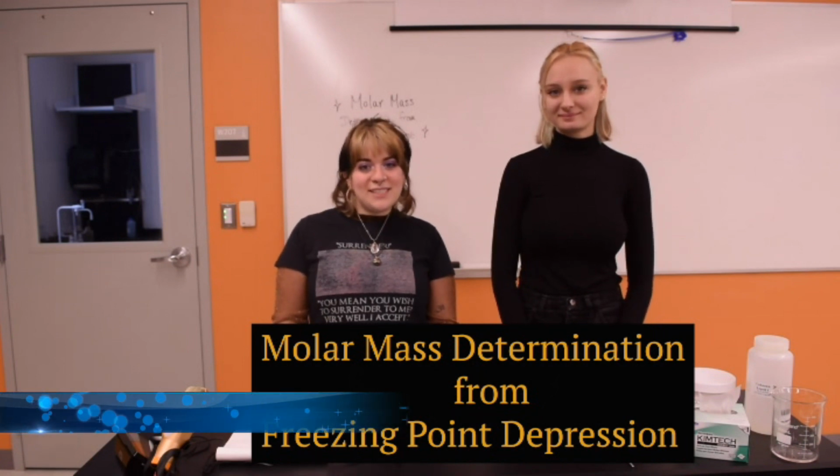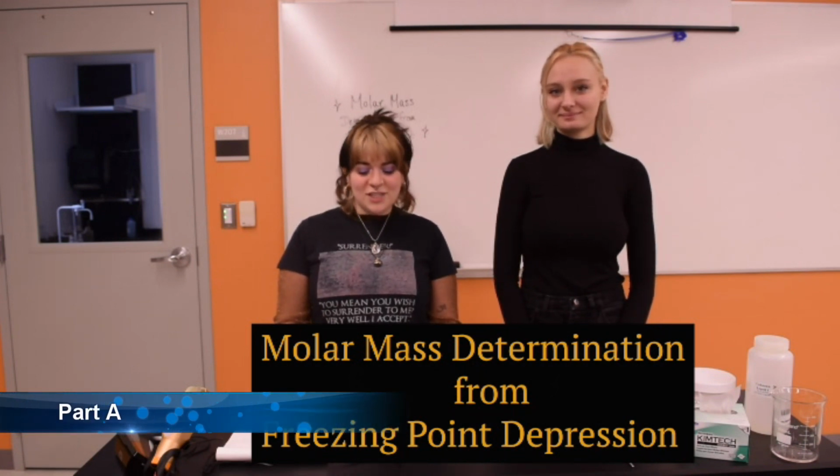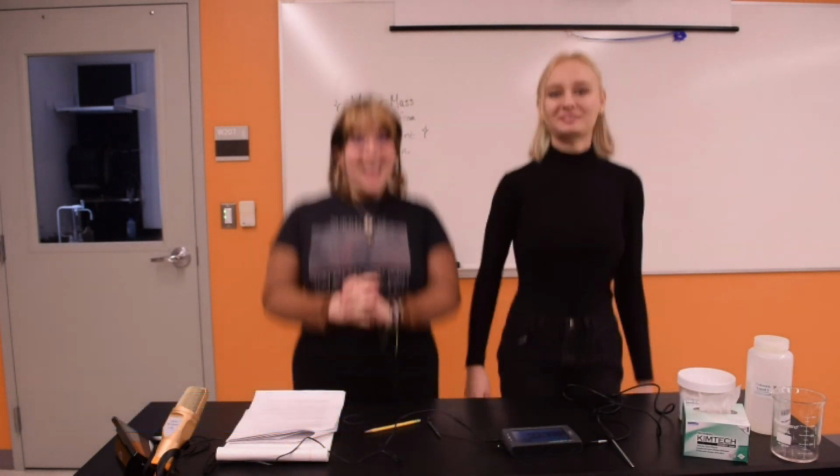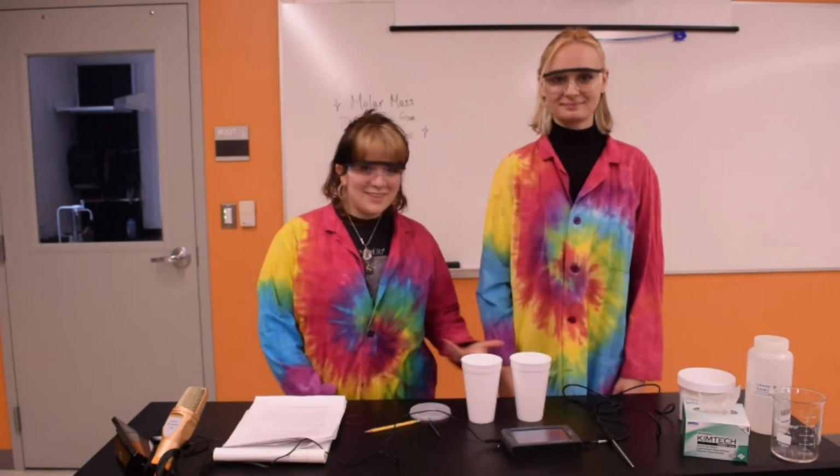Hi guys, welcome to today's lab, molar mass determination from freezing point depression. But before we get started, please make sure to put on all your safety wear. Alrighty, now we're ready to get started. First, you're going to need 2 styrofoam cups. Perfect.